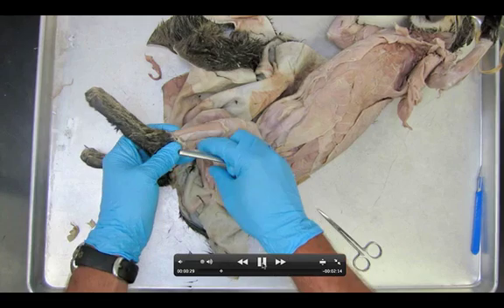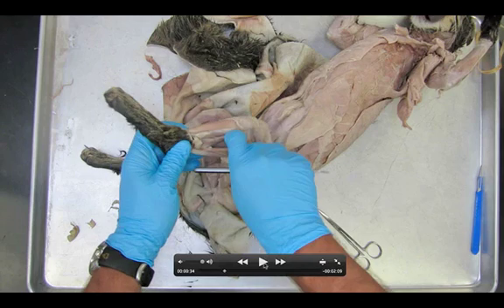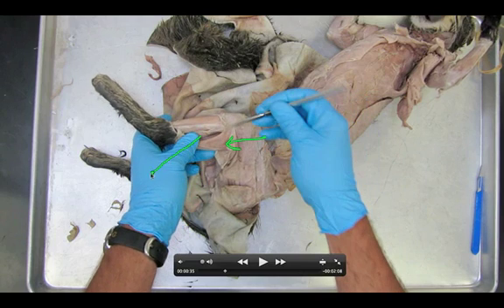I'm separating it right now from another muscle called the soleus muscle. We might be able to pause this video and you might be able to see a couple muscles here. I see the gastrocnemius — that's easy. You can probably see the soleus muscle here. There's another muscle right there. So gastrocnemius, soleus, then we see a muscle called the peroneus.